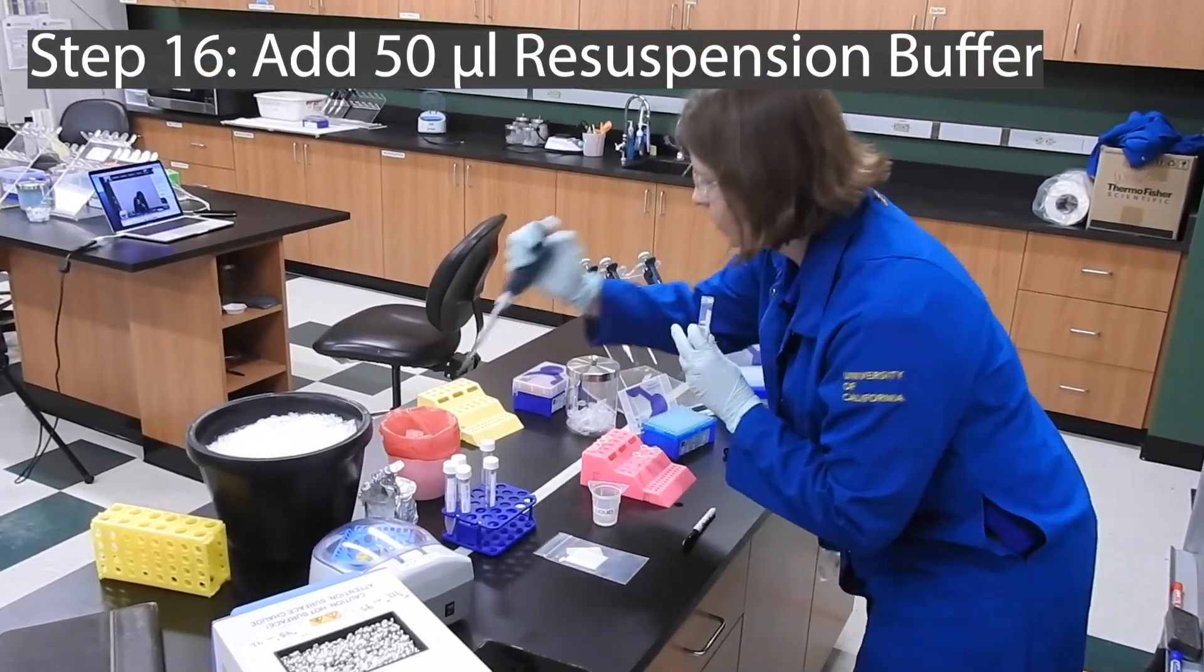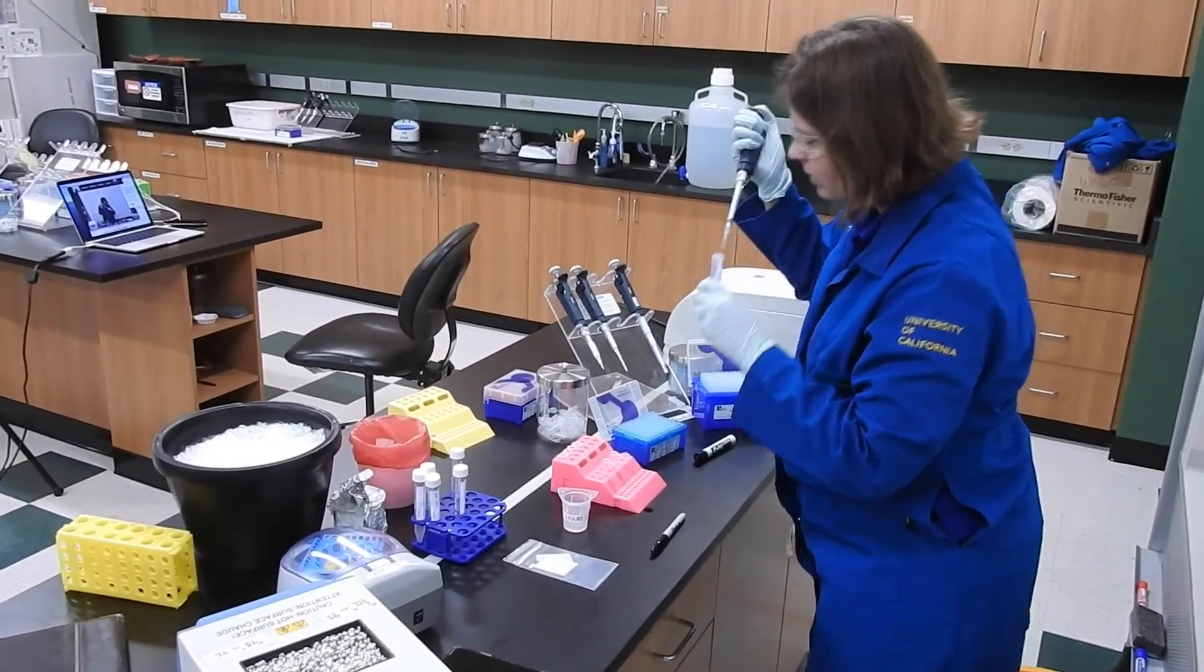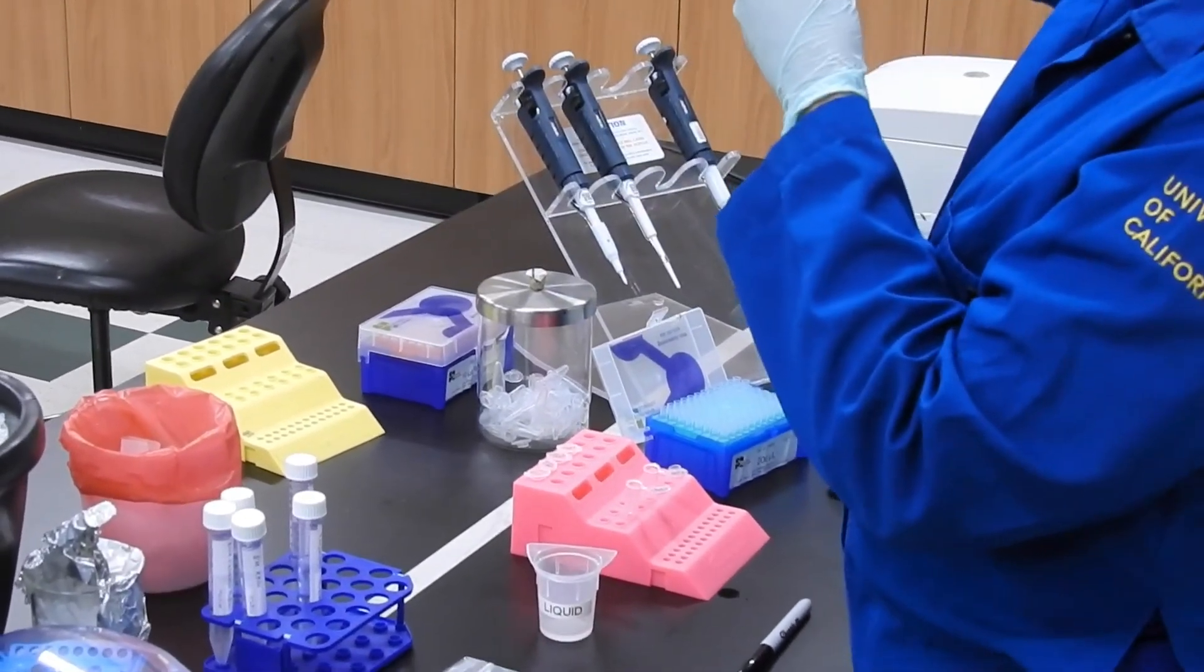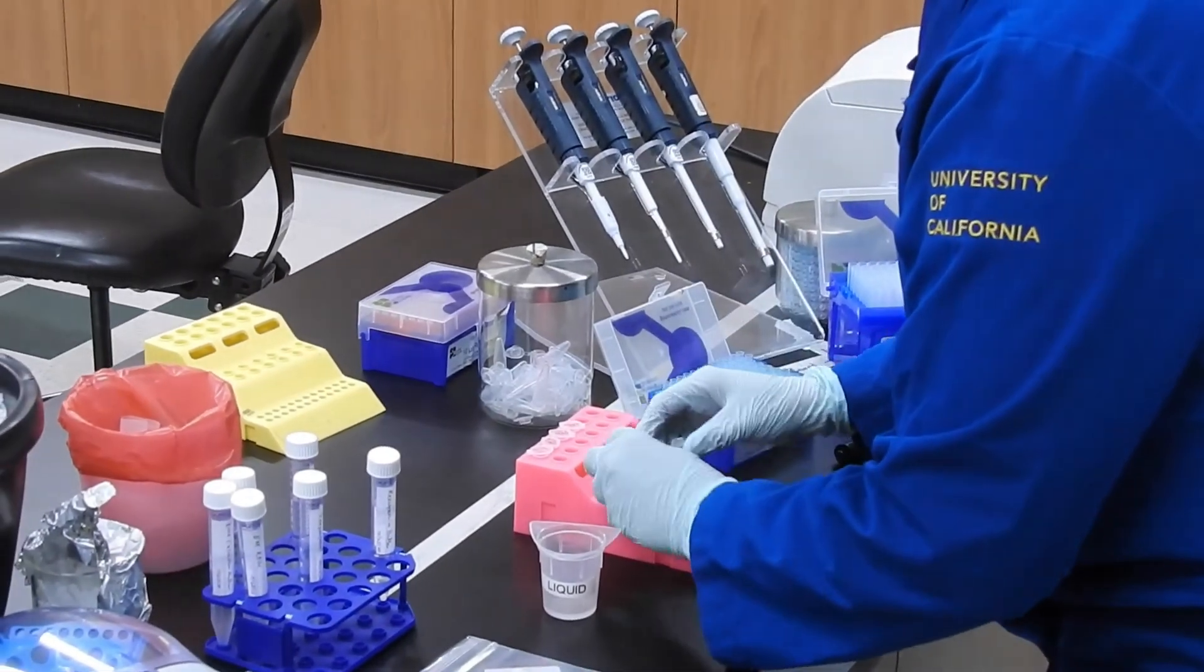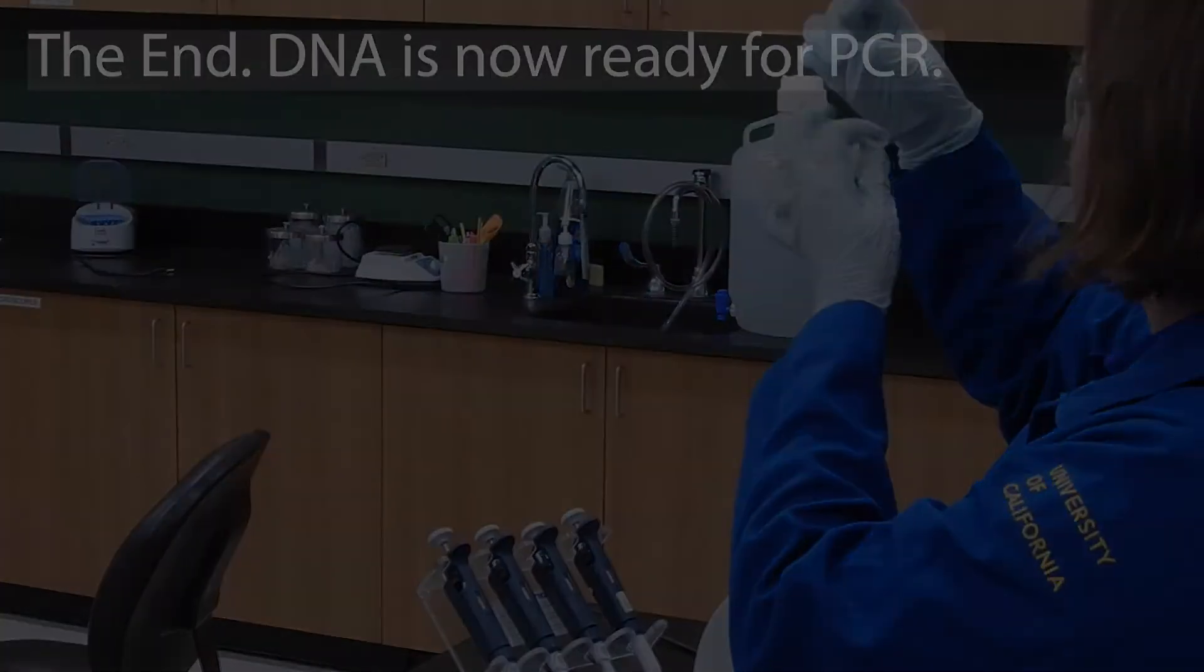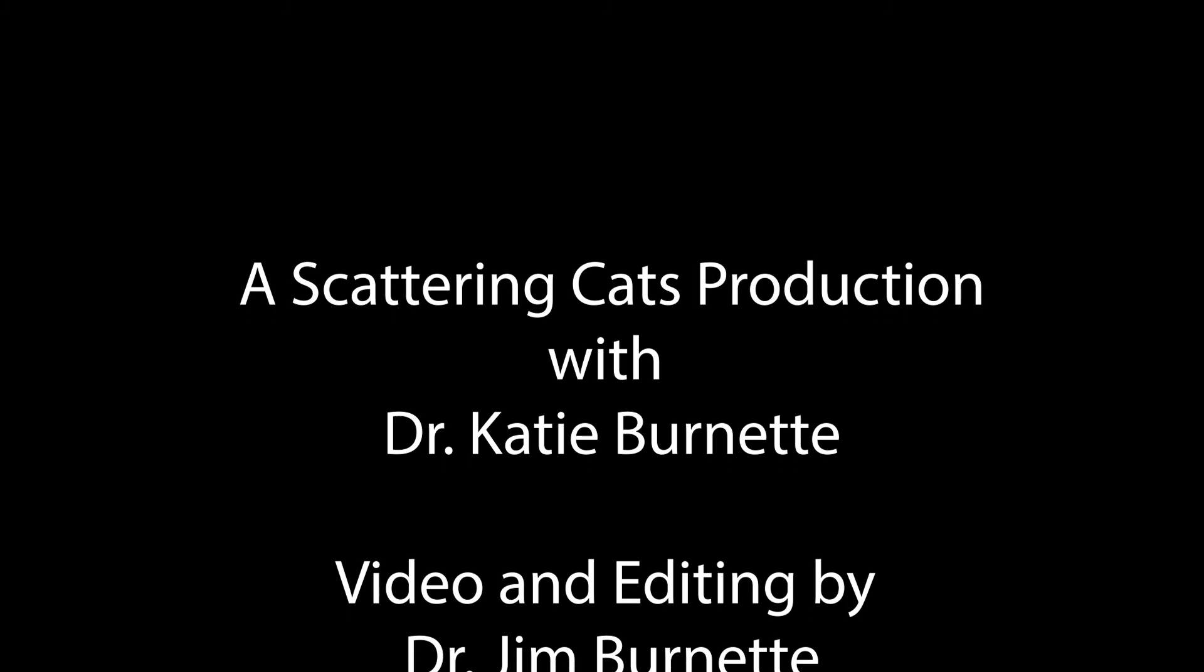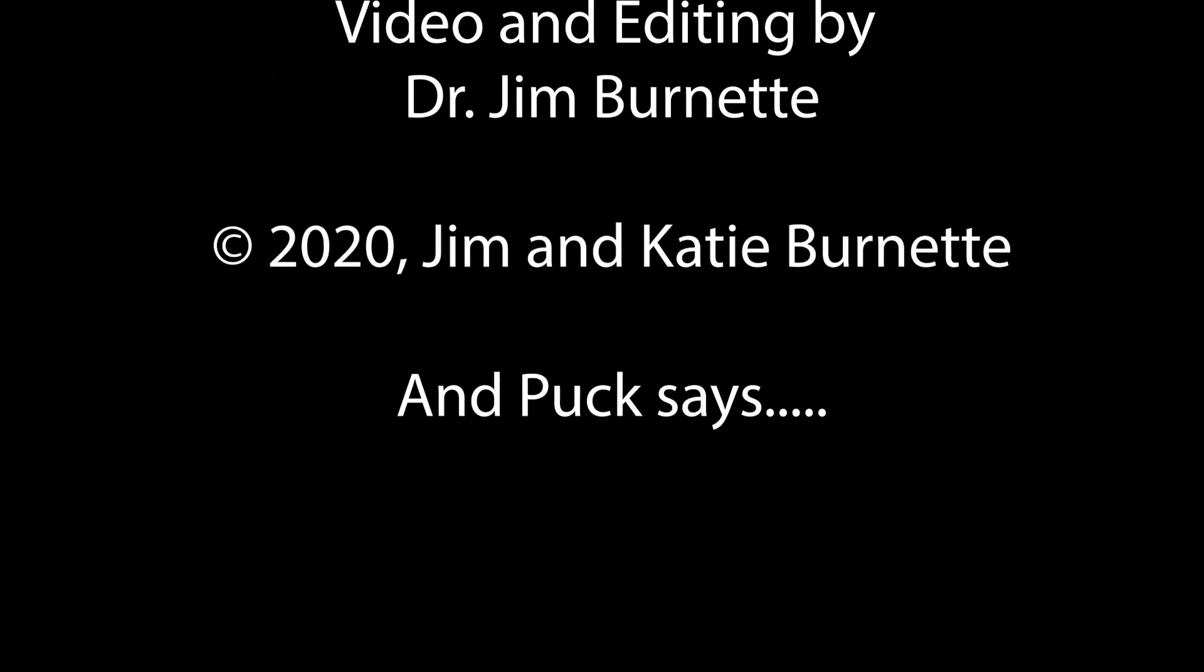Fish one. Fish two. Fish one. I don't have a vortex. Okay, I'm just going to flick it with my finger. That'll be good.